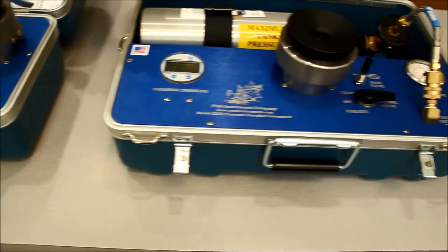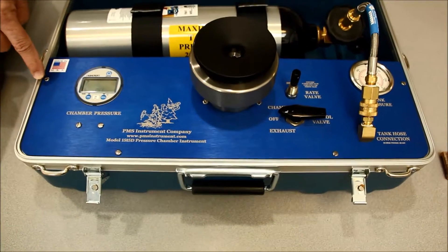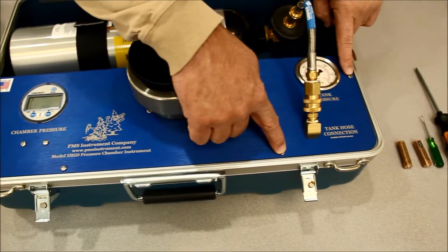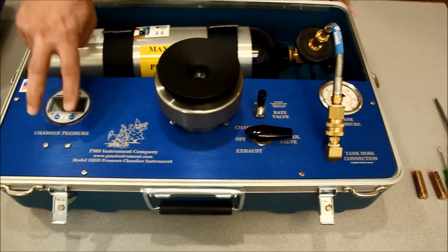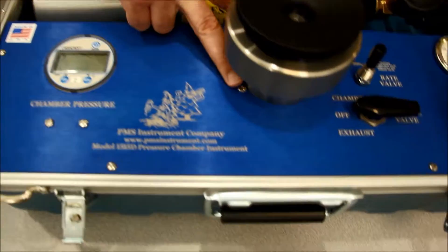If the instrument's a 615D or 1515D, the screws we're going to remove are on the outer edge. There are four of them. We want to take care not to remove any of the other screws that hold the gauge or the chamber in place.